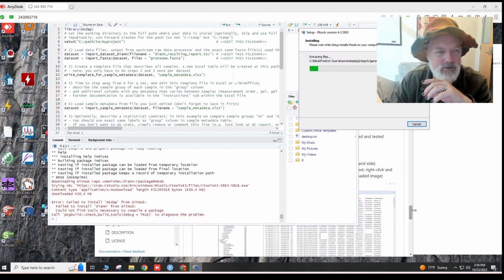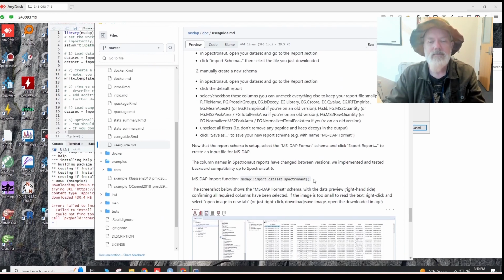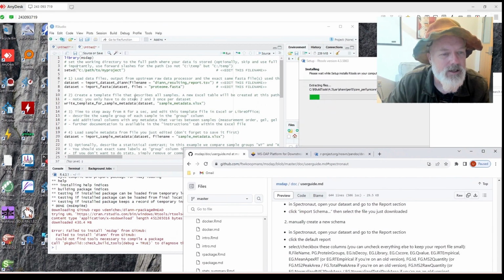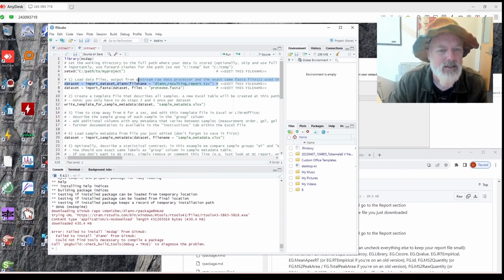Okay, so while this is doing this, we have to figure out how to import the report from Spectronaut into MS DAP. Basically, we need this import function, which we copy and put onto here instead of DIA-NN. Okay.